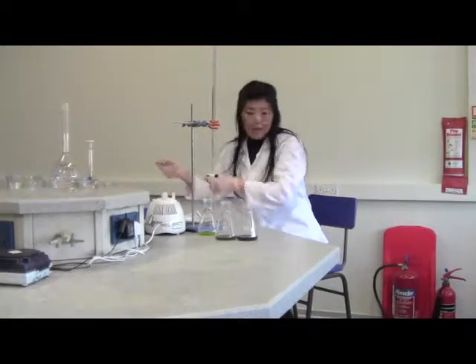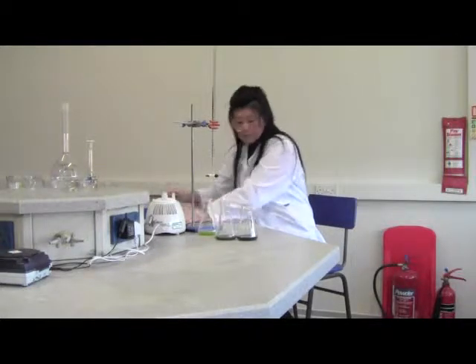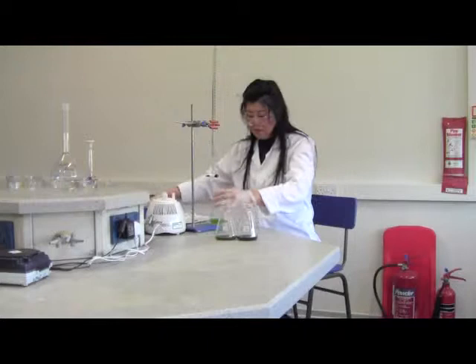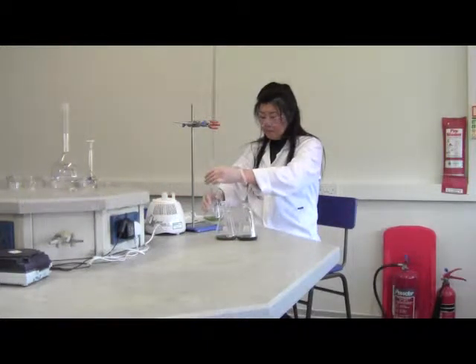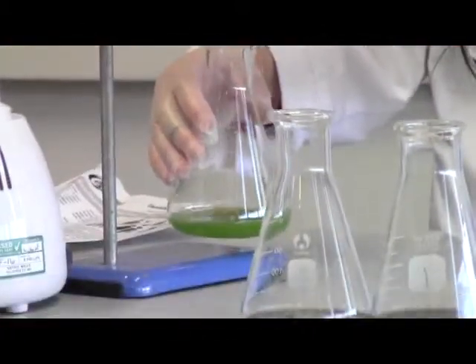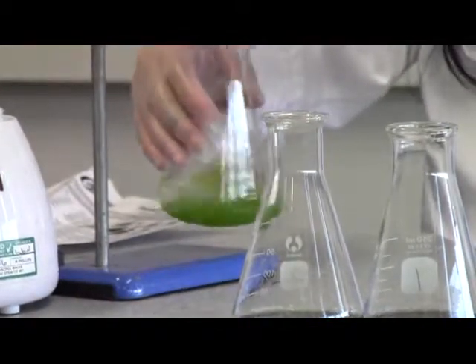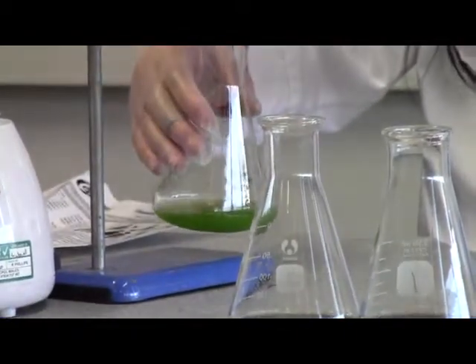Okay. The end point is 3.5 milliliter. Now I see the third one. Okay, as my start point 3.5, and into the third.